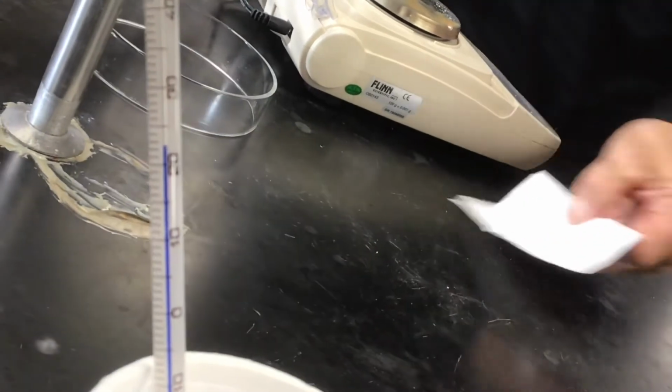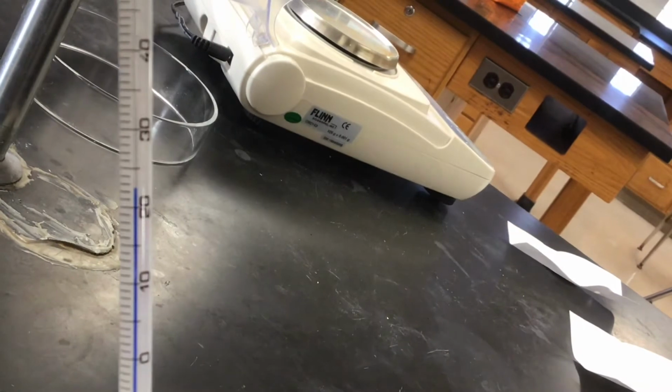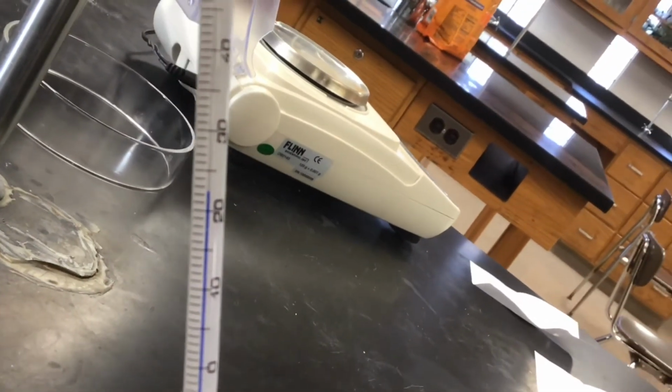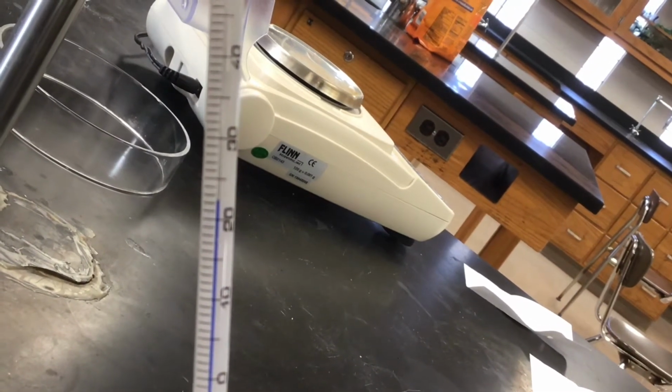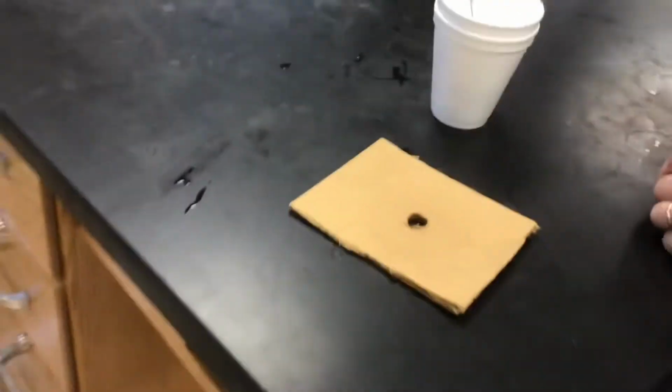That's not focusing very well. We get flashes. You want me to stand it up? Oh, we can see that well enough. Actually, it's a couple of tenths higher than it was the first time. Oh, was it? Yeah. Okay.